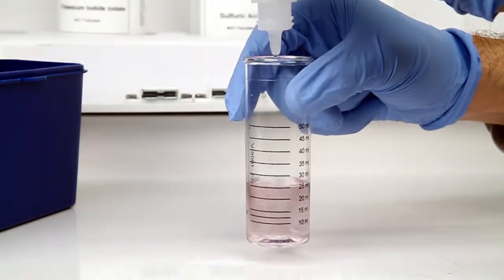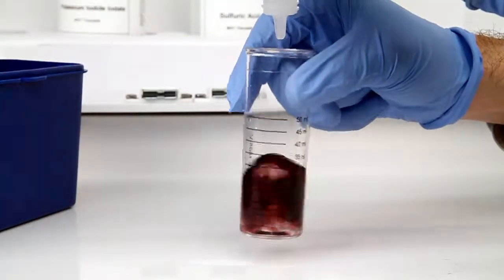According to the endpoint ID procedure, the titration is complete when the sample is changed from colorless to blue.